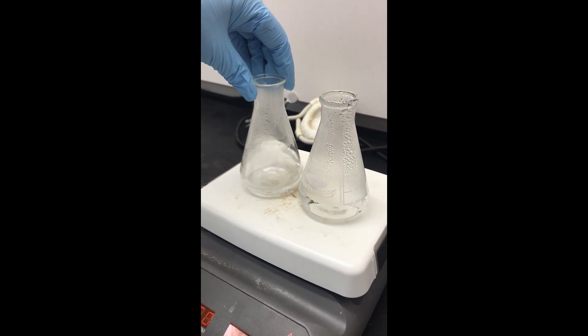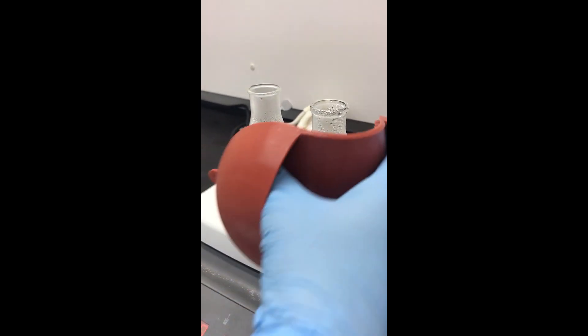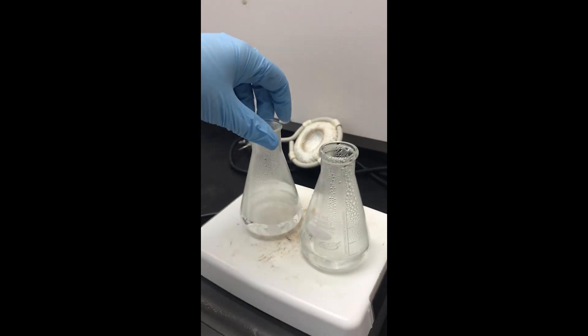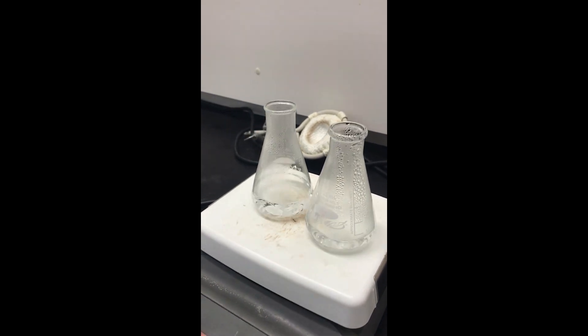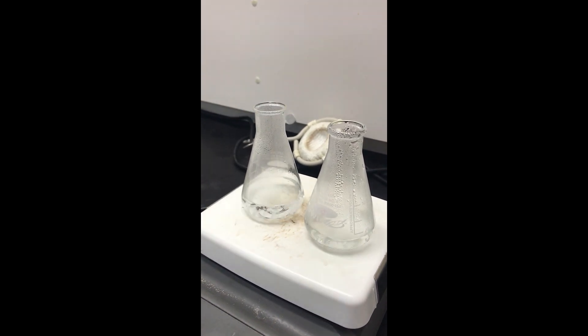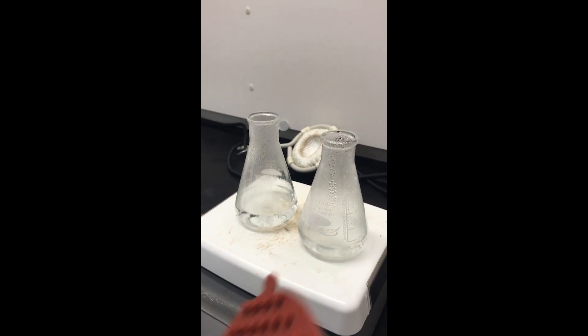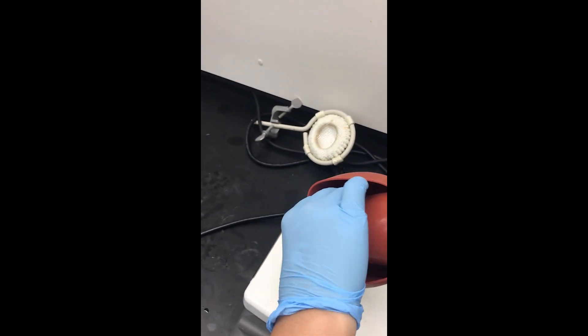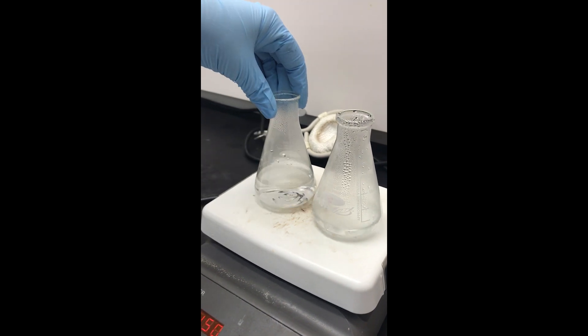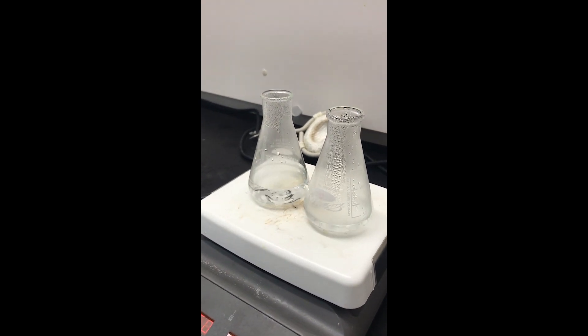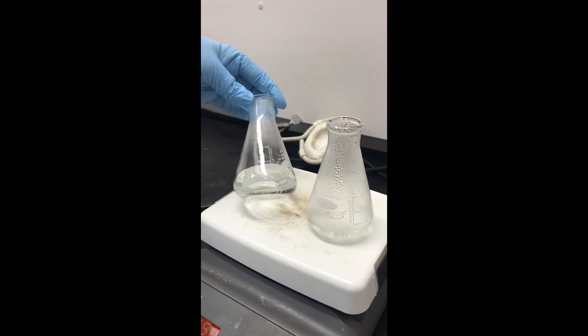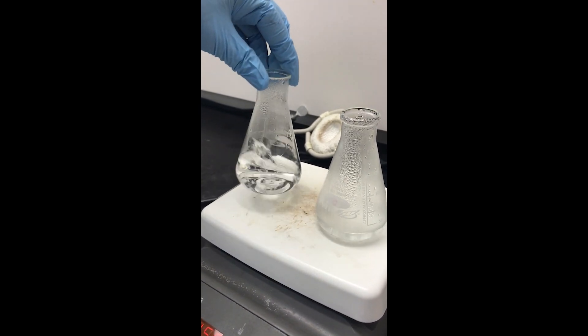It's important to be patient with the recrystallization. We're definitely getting pretty close. I see a few bits of solid left in there, but not a ton.